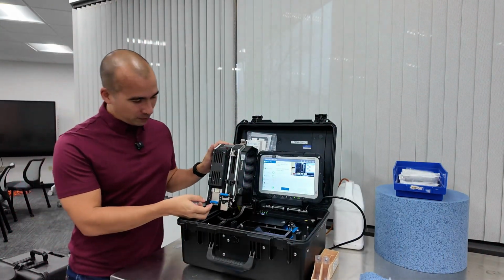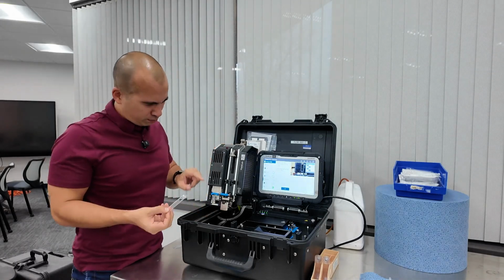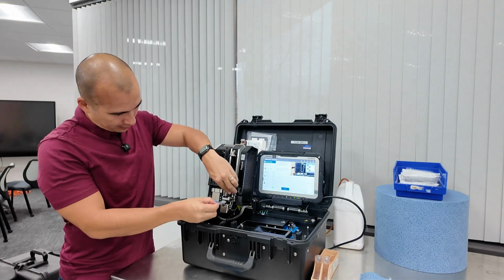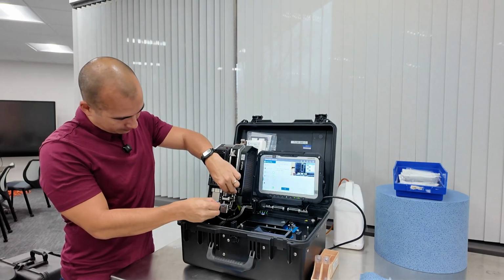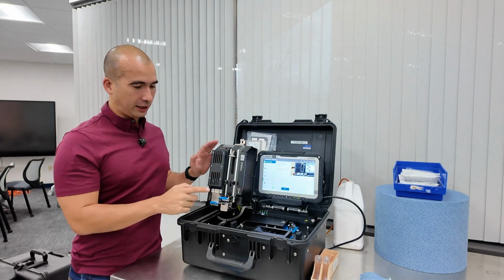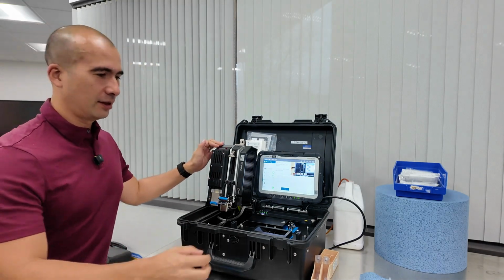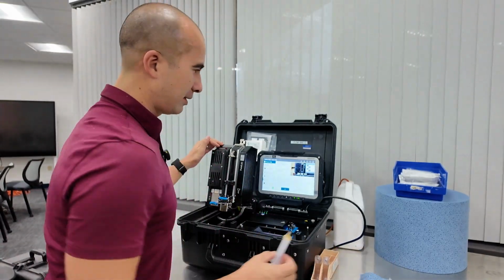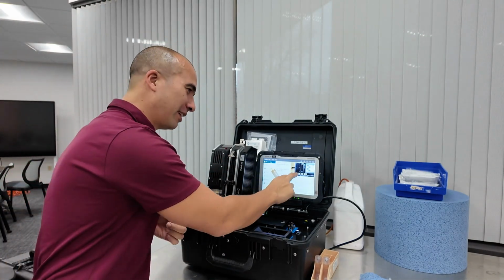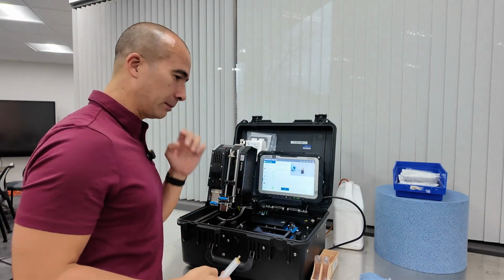All right, so remember that we had our 0 membrane in here. So we're going to pull this one out. Okay, this is going to go, do I need to lift this up? Yes. Push this one in here. Okay, close that up. So that's the filter patch. And remember, if you ever forget the steps, which I have a couple of times here, you can always hit play and it will give you those steps.